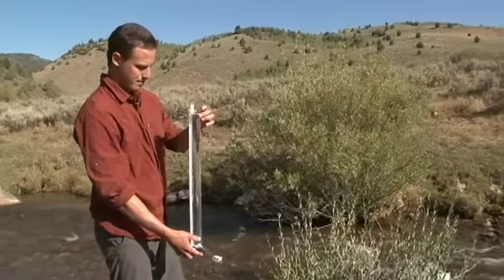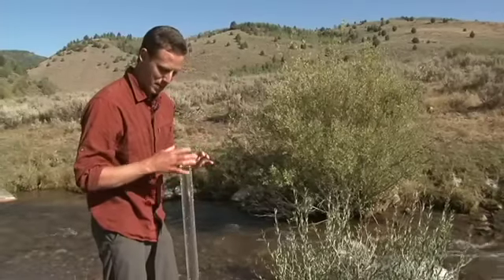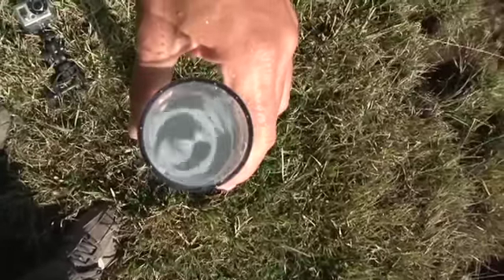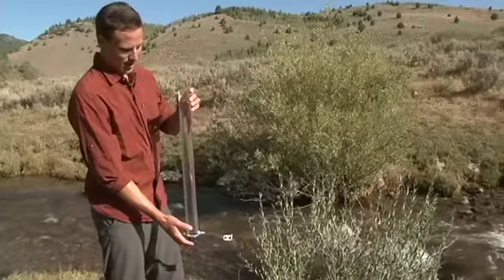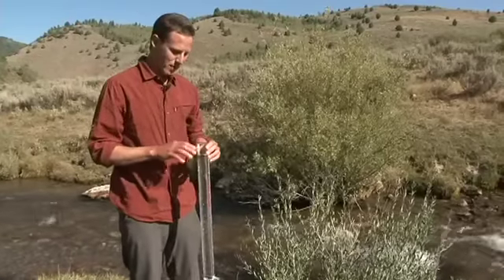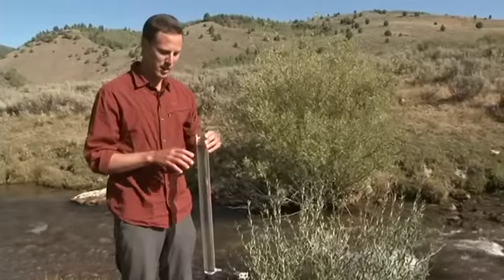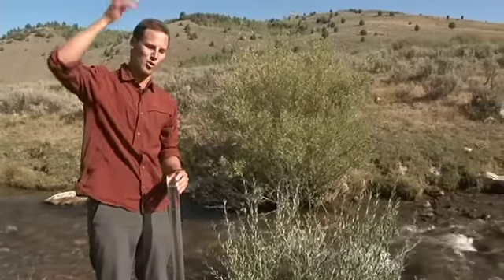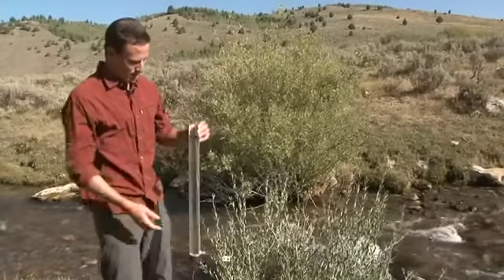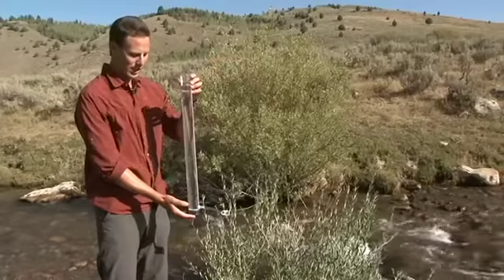Once you've filled it all the way up, you want to make sure that you can look through the tube and be able to see. If you can fill it all the way to the top and look through the tube, then you will record that the whole water column is clear. On your datasheet, you would select the greater than symbol and write down 60 centimeters. In theory, if I had a longer tube, I could keep filling this tube up to increase the clarity reading. This is what happens when you have a very clear stream.